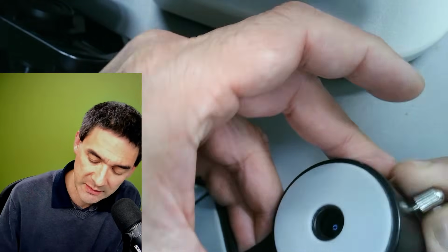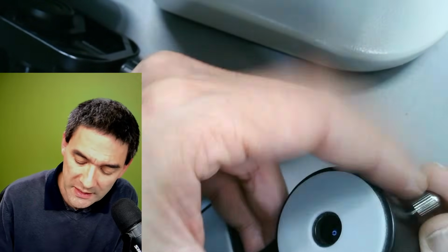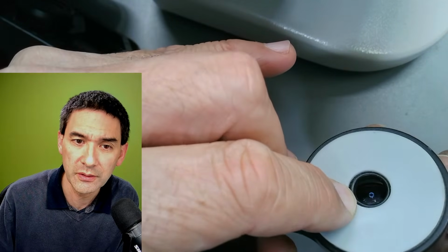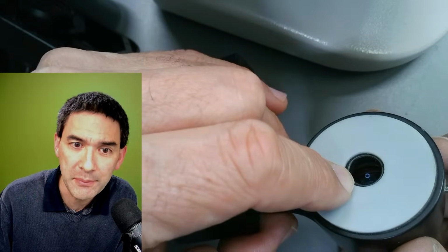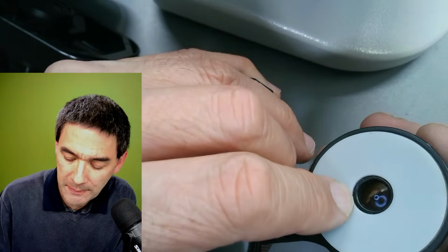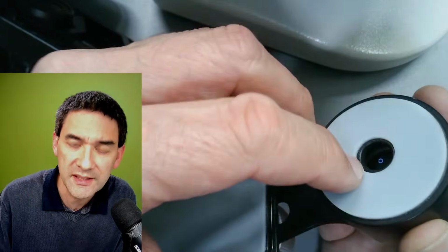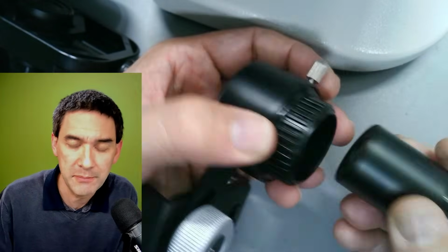And I've also had an adapter once, and it depends a little bit also on the eyepiece combination. I moved it all the way in, and the distance was still too large. This has to do with the so-called eye relief of the eyepiece. So you see that this is already a problem with some adapters: even though it looks quite nice, I'm not able to fully adjust the distance. Then you might have to get yourself a different eyepiece.